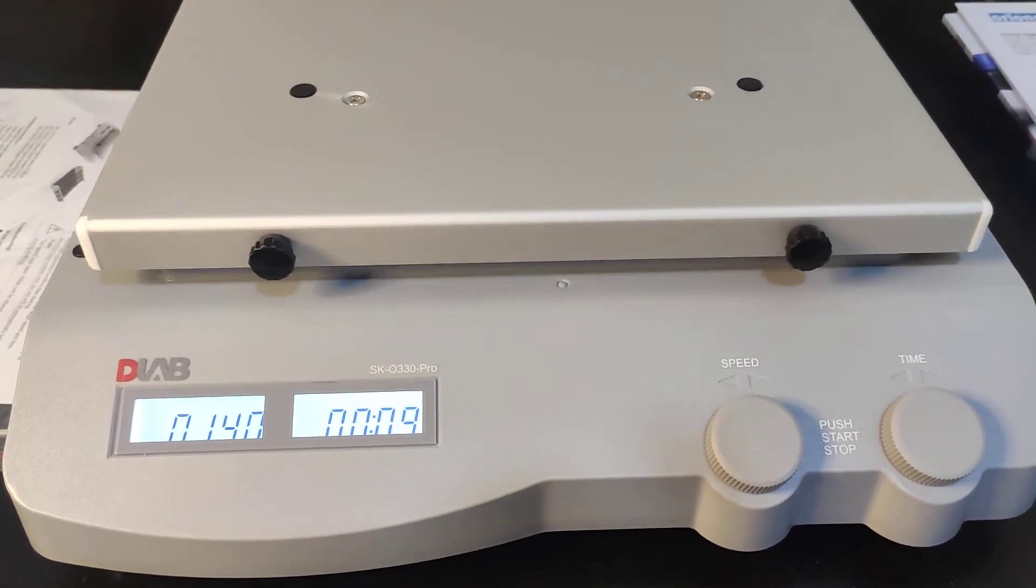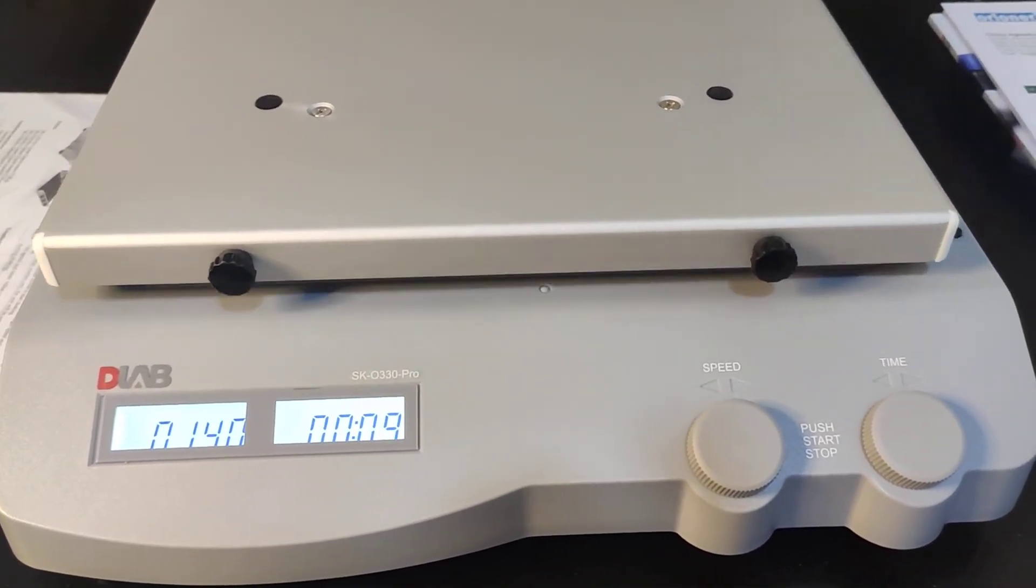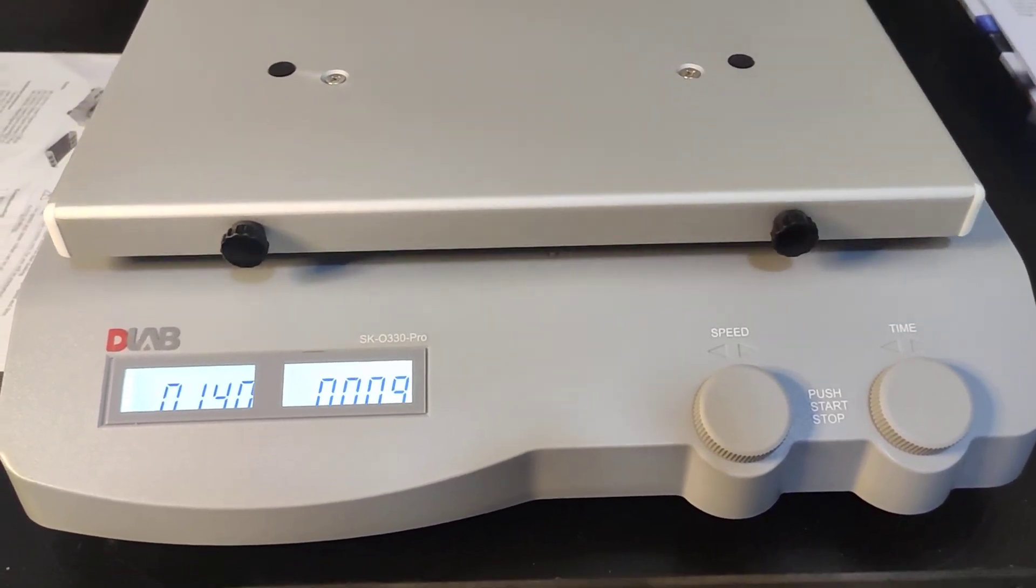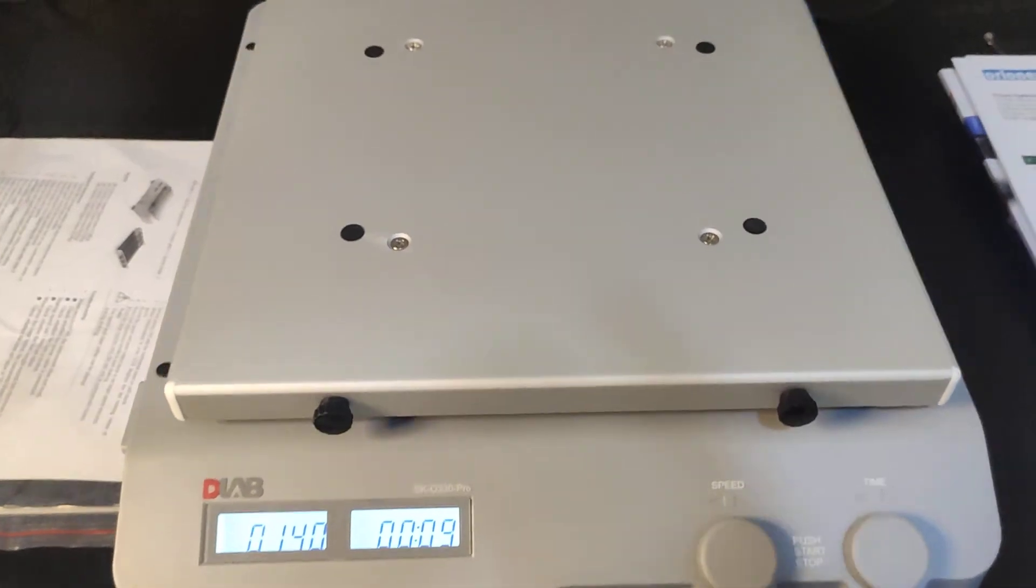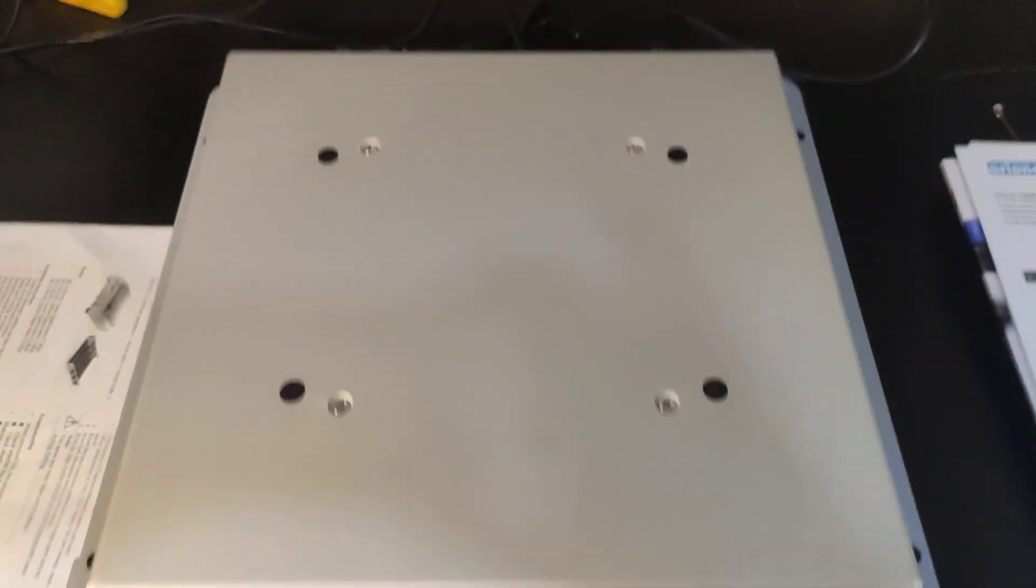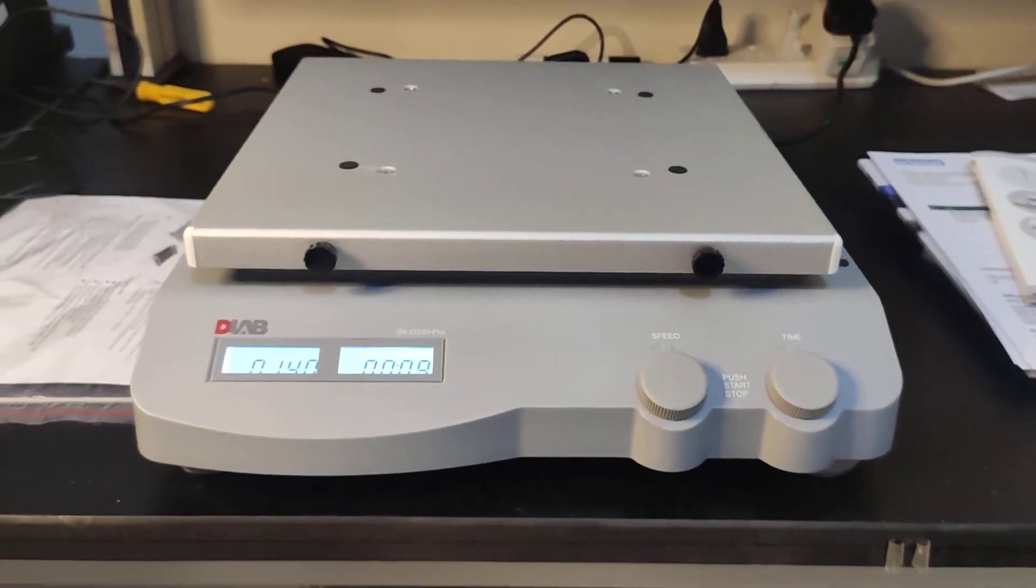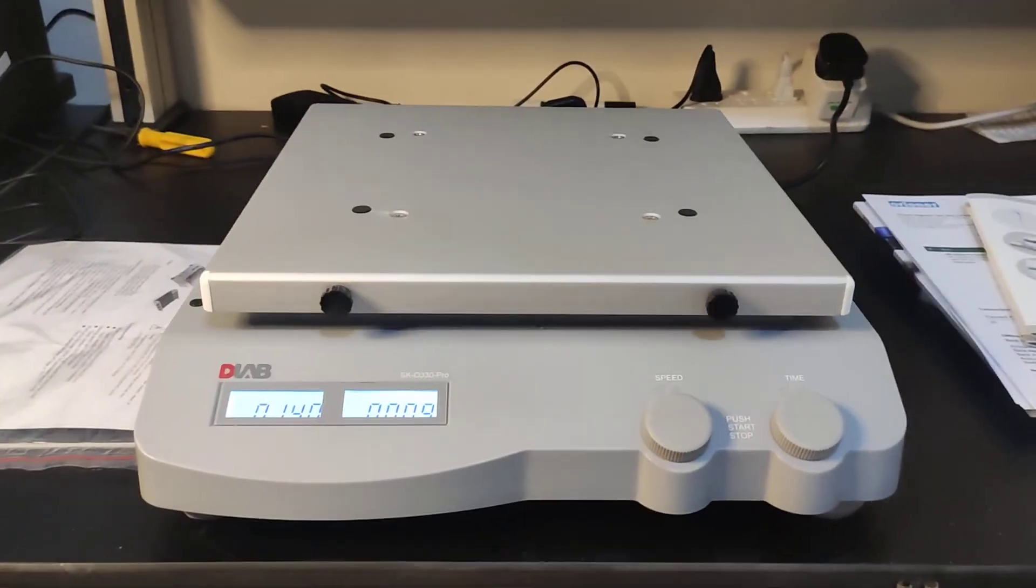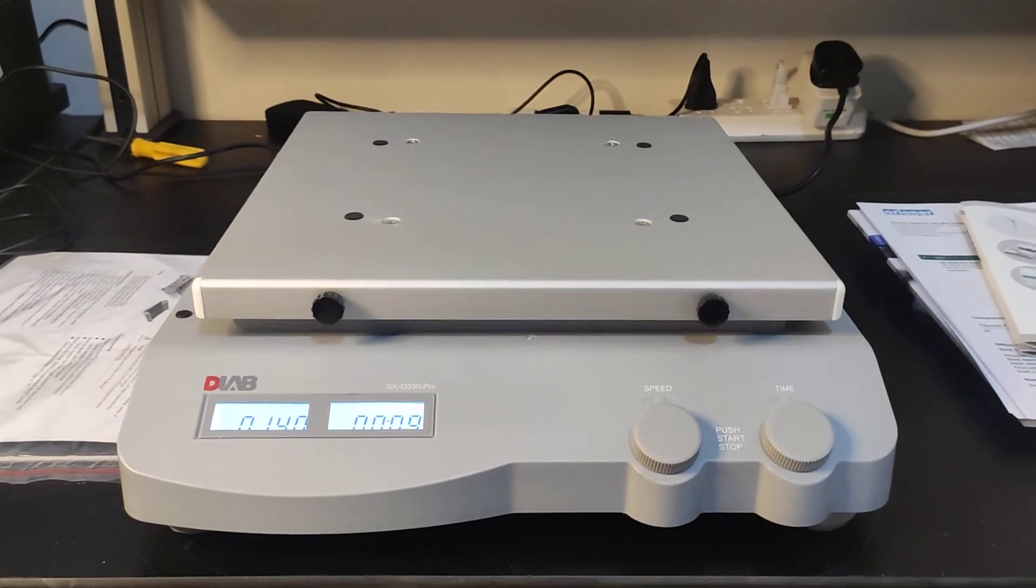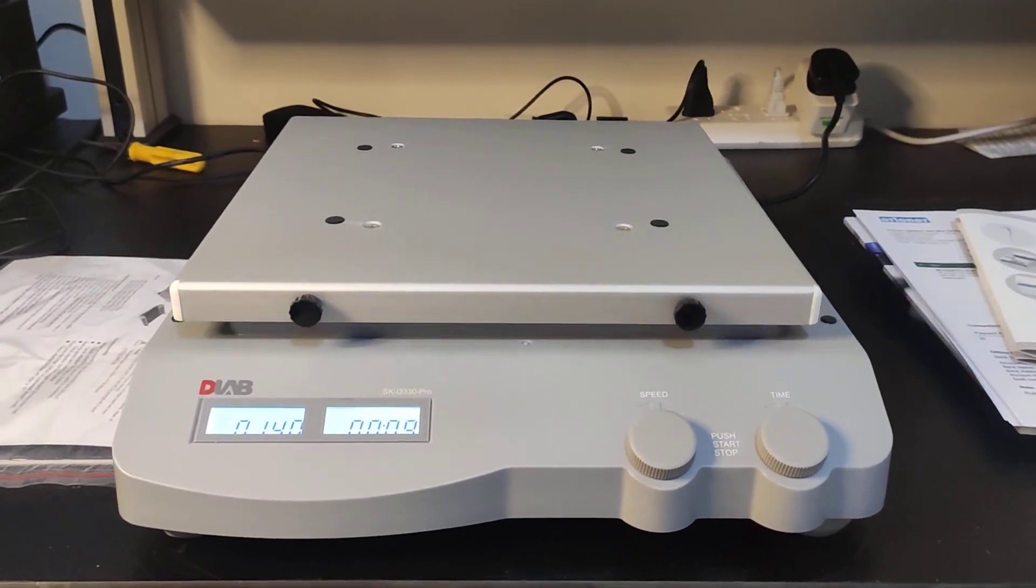The time from 10 minutes changed to 9 minutes. This is basically how this shaker working. Thank you so much.